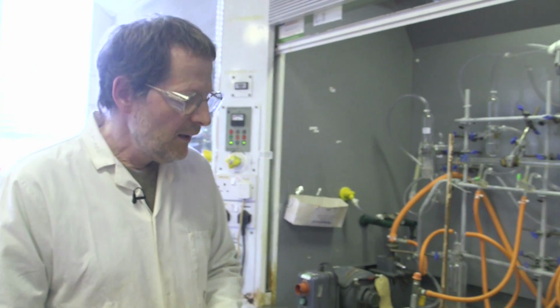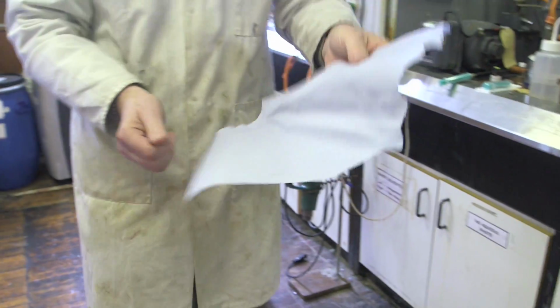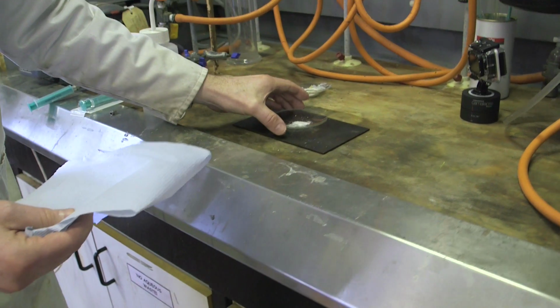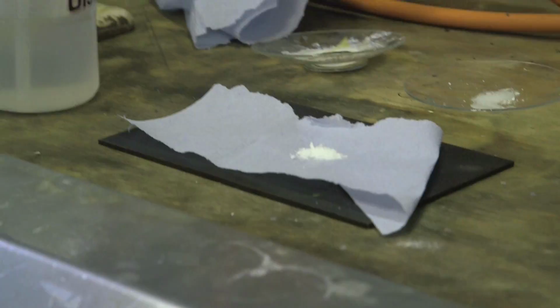Now, although this is kinetically stabilized, it's still got all of the potential power to make those very strong aluminium to oxygen bonds. For this one, I'm going to give it a little bit of fuel. So I'm going to cheat by taking a little bit of tissue. This tissue happens to be blue as opposed to your normal white tissue, but I'm going to move that out the way, and so I guess that looks okay. About a spoonful. I'm going to put it on the paper like so. So again, no major reaction.